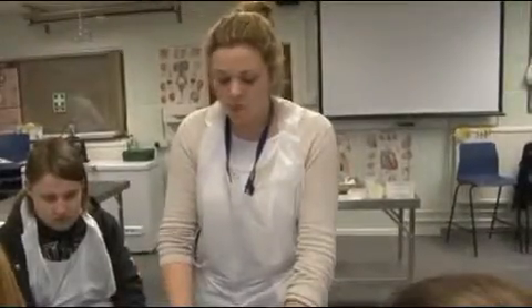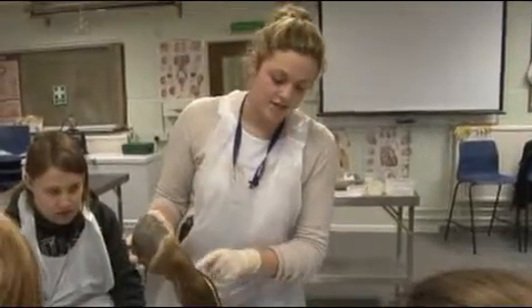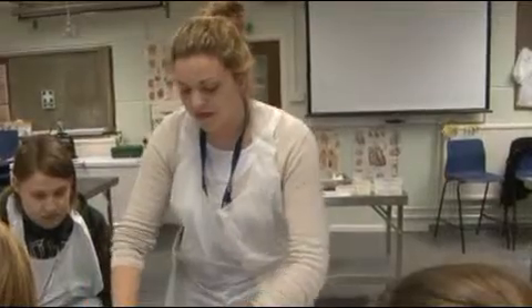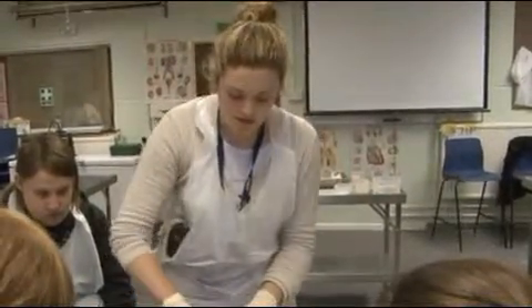It's really tough. You can see when you open up the front of the horse leg that you have a tendon here which is running down the front. When you start working in your groups, they'll come round to help you identify that. Can you see that tendon there which is running down? So make sure you leave that on the leg as you're skinning. What you need to do is just cut away the skin, leaving the tendon there. You need to cut all the way round so the skin comes off to about here.